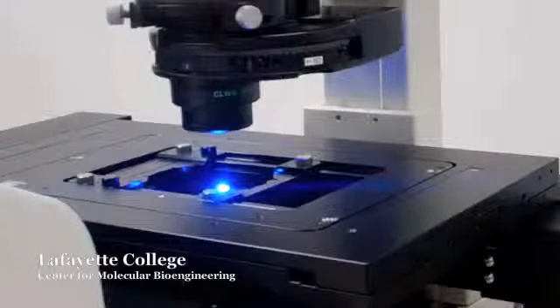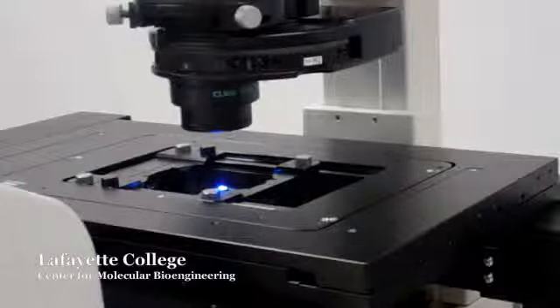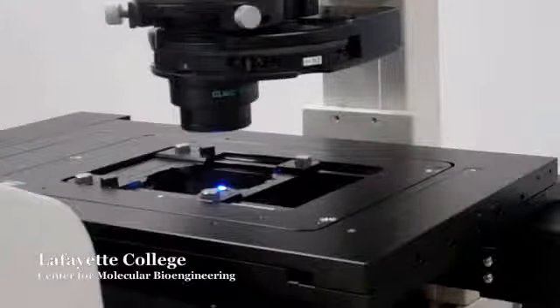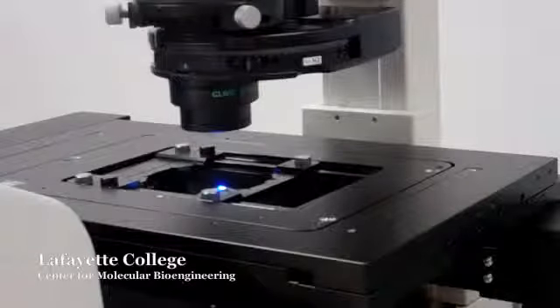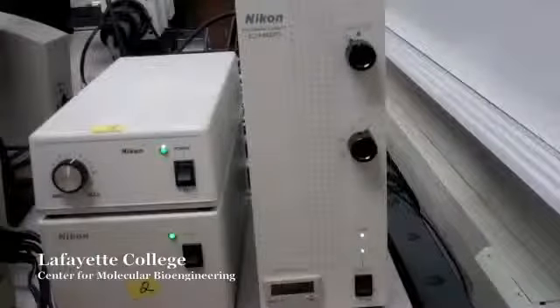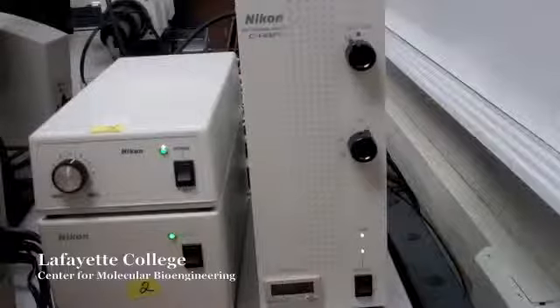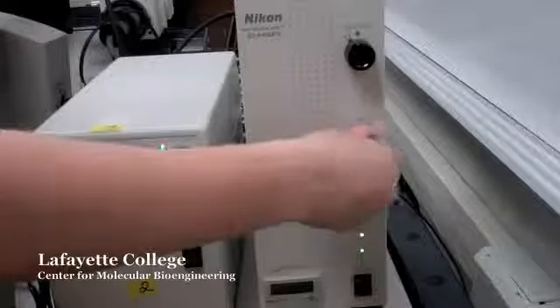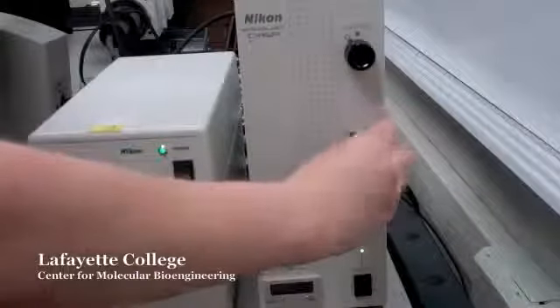It is important to adjust the light intensity to a desirable level. If the fluorescence intensity is too bright, it may quickly quench the samples. There are several ways of adjusting the light intensity. One way is to adjust the neutral density filter found on the Intensilight box. The knob is labeled with numbers between 1 and 32, 1 being the brightest and 32 the dimmest.